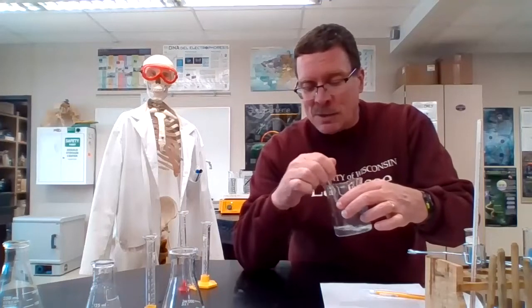Remember, yesterday when we were doing concentration, we had the full-on 10, 10, and 5 milliliters of each of the substance, landing about 30 seconds. And that would not, under heat condition, give us almost enough time to measure it. It would be so rapid. So here we go.